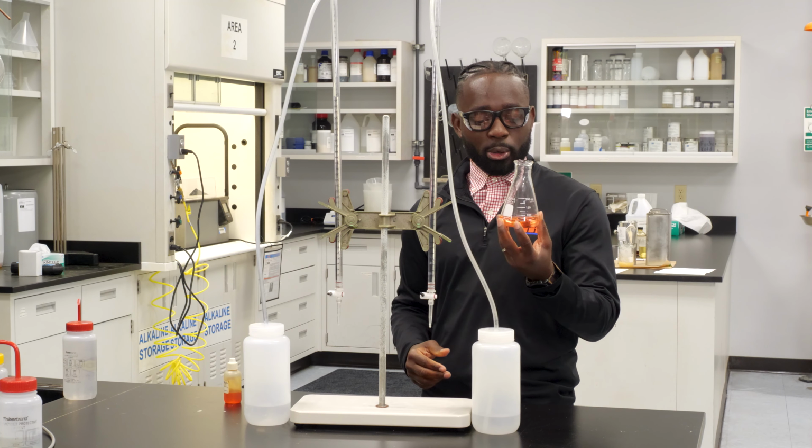You can find the calculation on our TDS, and you can plug in the 6 mLs and you'll have the concentration of your unknown solution.